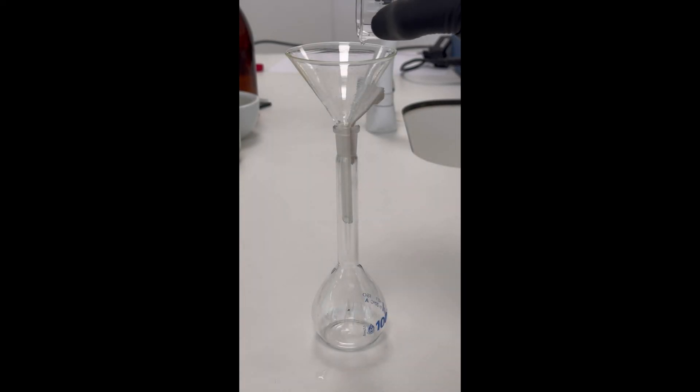The calcium carbonate is then transferred to a 100 milliliter volumetric flask, rinsing the crystallizing dish with water. Then roughly 10 milliliters of hydrochloric acid are added to the flask. Immediately, you can see bubbling caused by the release of carbon dioxide.